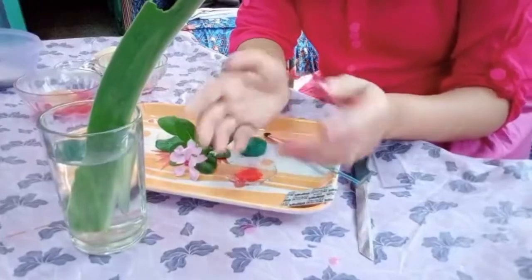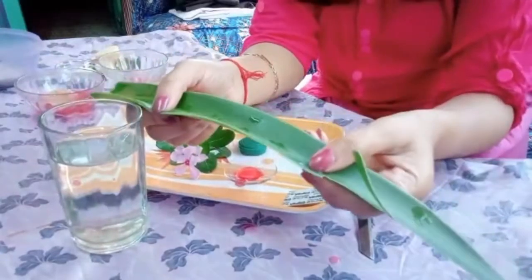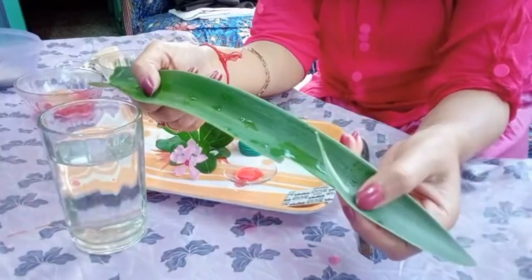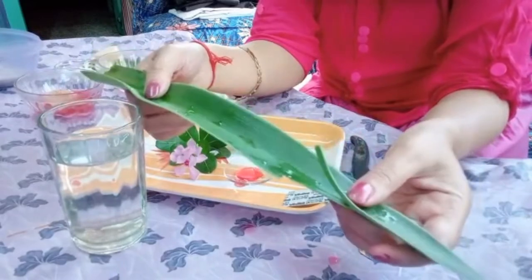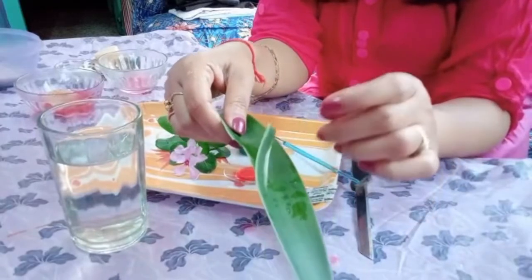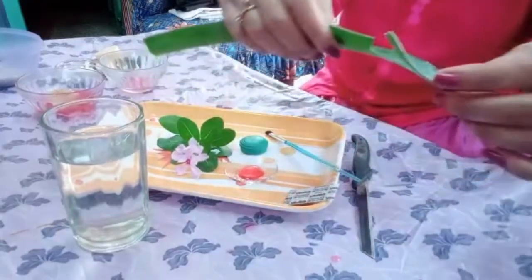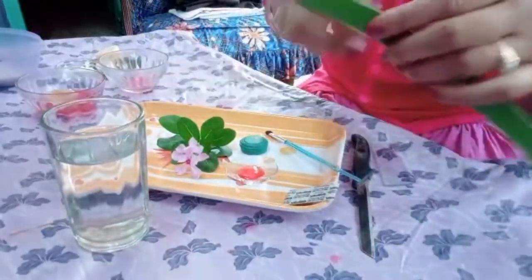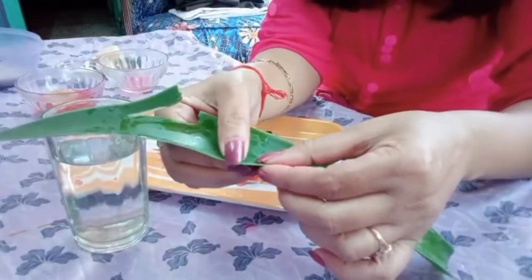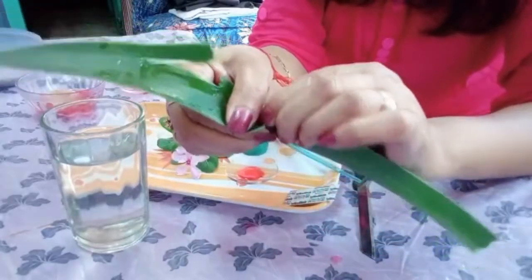Now let me show you the technique how to remove the epidermal layer. In this experiment, as I said, distribution of stomata, I have chosen such a leaf which is quite a thick one, and if you ask me why I have chosen a thick leaf, the reason is, for a thick leaf it is very easy to show you the removal of the epidermal layer. Now you can see already I have taken out a portion. Still I will try to show it in front of you so that you can practice it. Try to remove it in such a way that clearly you can see the epidermal layer.